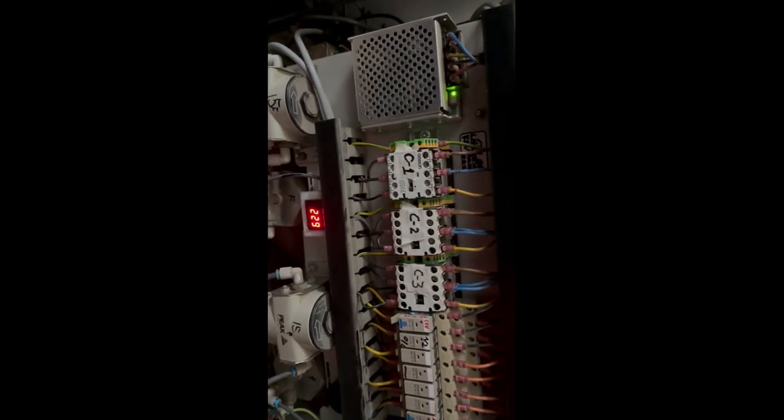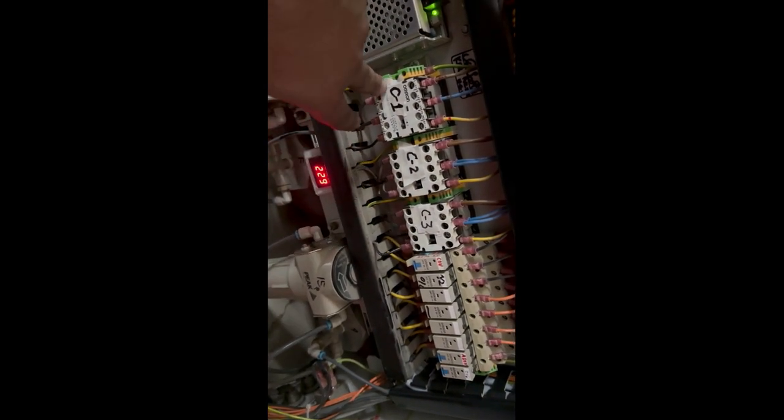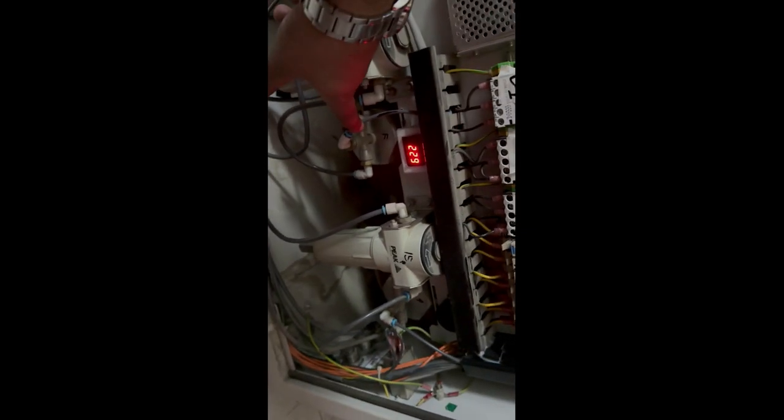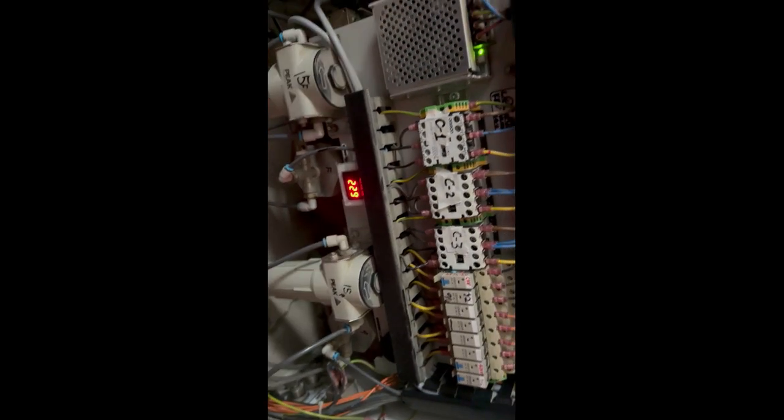So it's normal operation. Here we have 3 magnetic contactors for compressor 1, compressor 2, and compressor 3. I just marked them for my troubleshooting. Here we have the 24 volt DC power supply. Here's the voltage indicator. So this is all of the electrical hardware, and here we have 2 tanks, the first tank and the second tank, one for nitrogen storage and the second one for air storage.